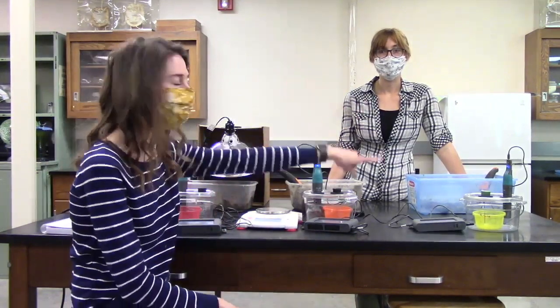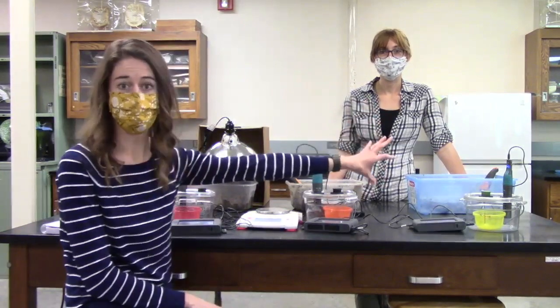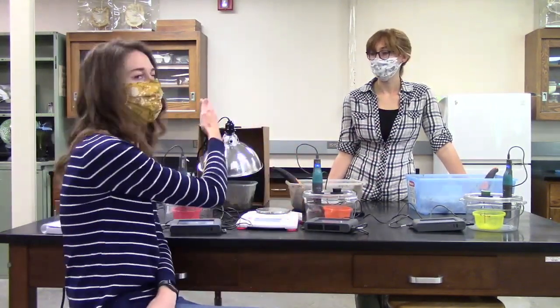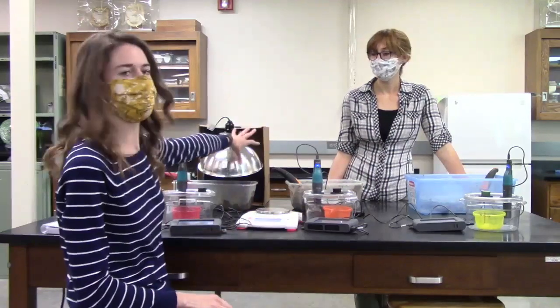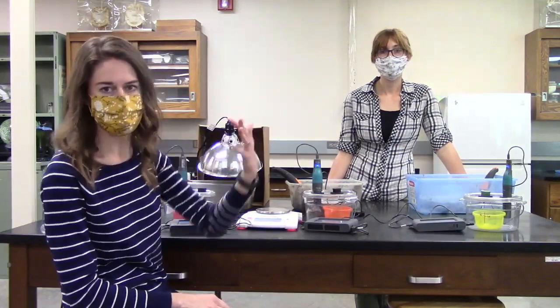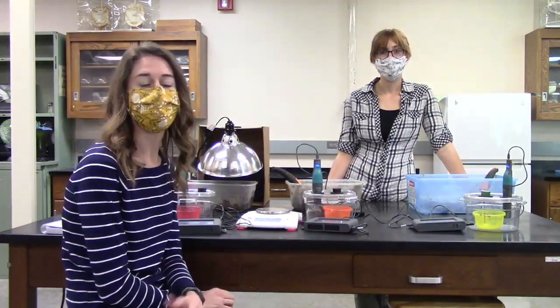So today we have 3 soil samples. You probably saw this in your manual already. We have cool and dry, so that soil has no moisture added to it. We also have cool and wet in the middle here, which we added some water to just before the lab today. And then we have warm and wet. This is our little ceramic bulb heat lamp, which is just warming that soil above room temperature. And it usually gets a lot of heat in there.